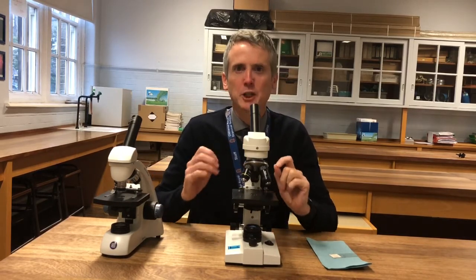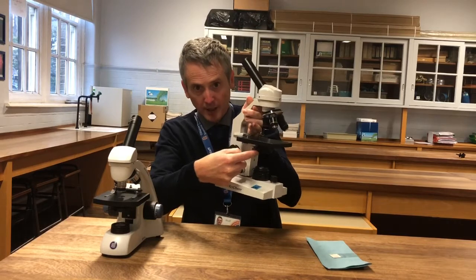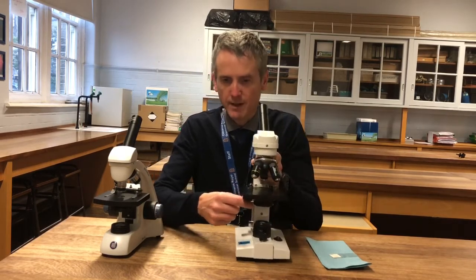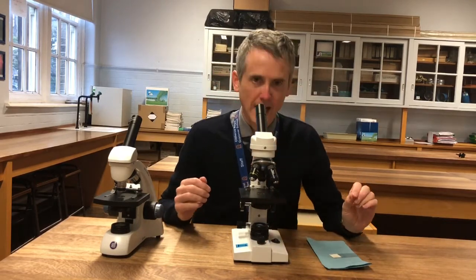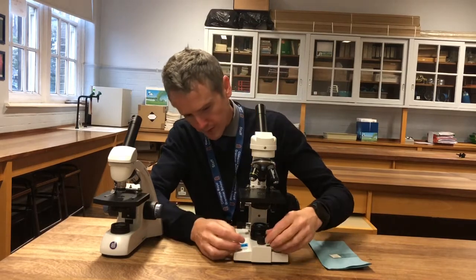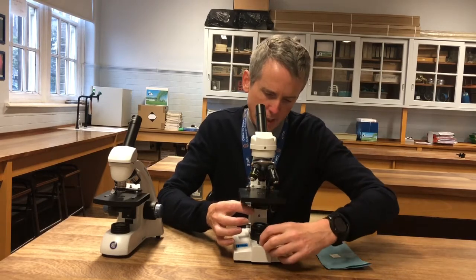A small aperture also means that you get more contrast, and you want a nice high contrast view. We change the aperture size by moving this little lever here, and you can experiment when you're using a microscope — move it backwards and forwards to change the amount of light. Students often have the iris wide open, they have too much light coming through, and all they see is light. It's like taking a photograph with the sun behind you — it will just obliterate the actual image. So manoeuvre this lever when you're looking down and change the aperture to get the best quality view possible.